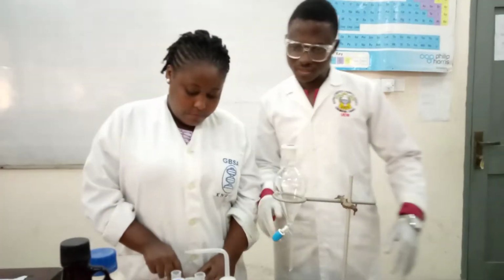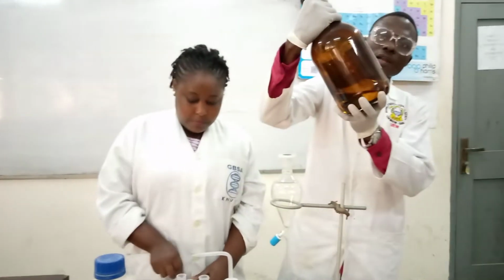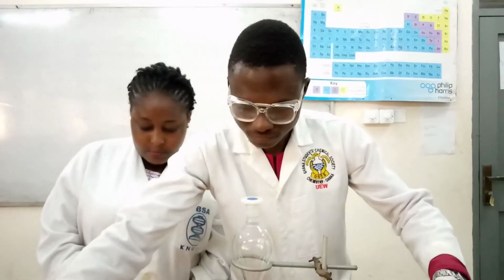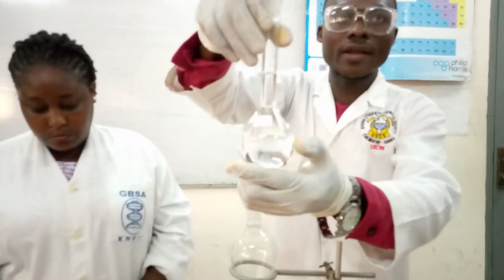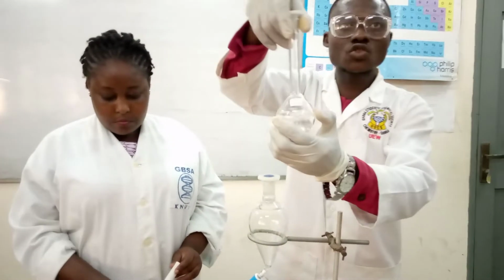Okay. Viewers, the other chemicals we use for this experiment are the ethyl ether. We also have the 3 molar HCl, hydrochloric acid. And we also have 3 molar sodium hydroxide.